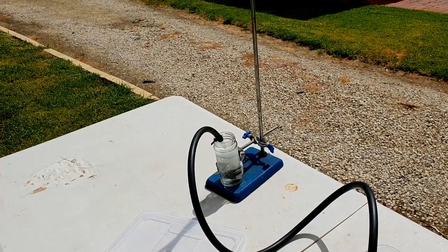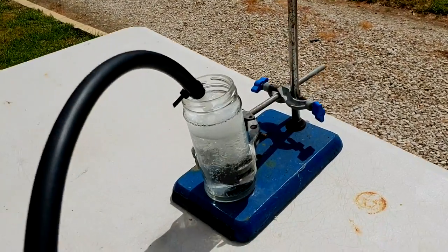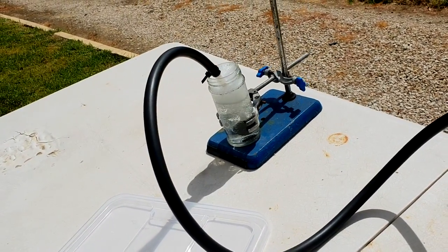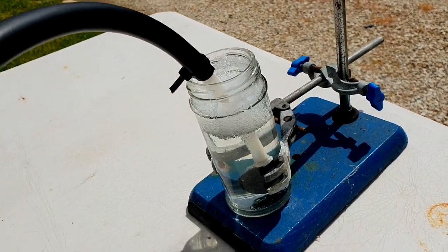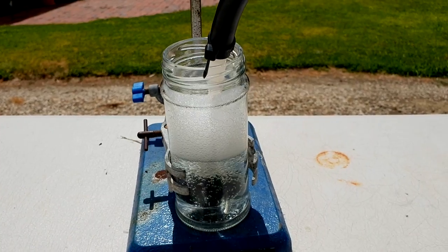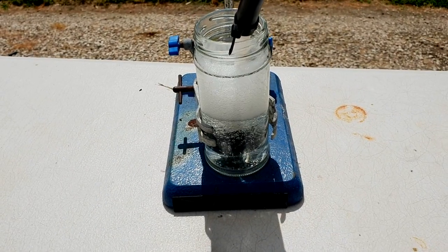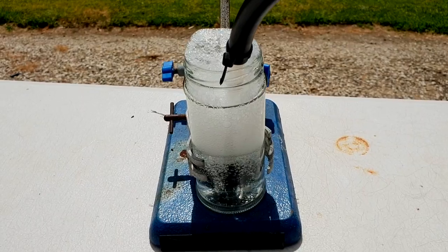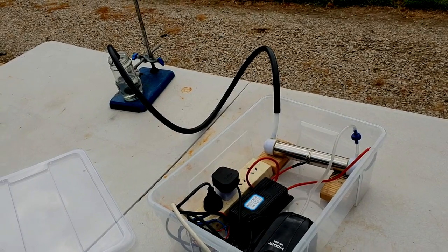Yeah, that's all right. It's foaming a bit though. Is it going to stop foaming? No. Okay, let's turn it off. All right, let's half that volume. I think it's holding steady. I think that's on the minimum pump setting, so we can crank it up. And that is going to overflow. All right, we're ready to go.